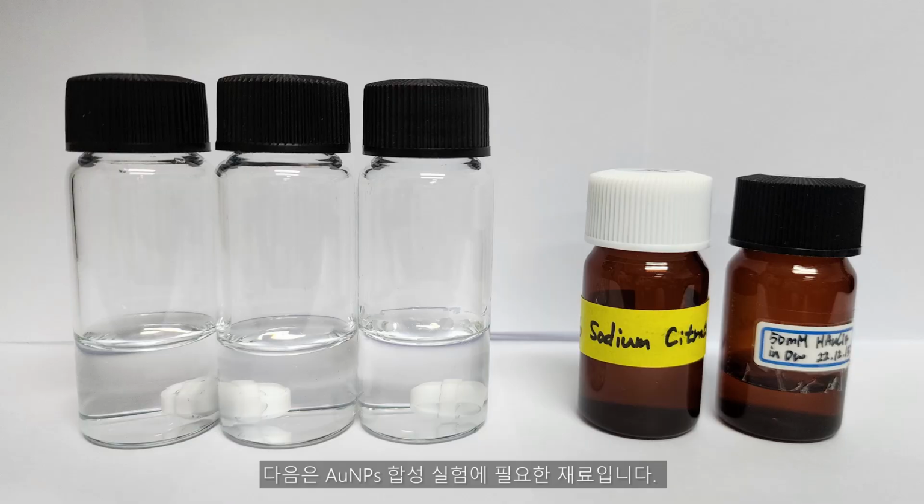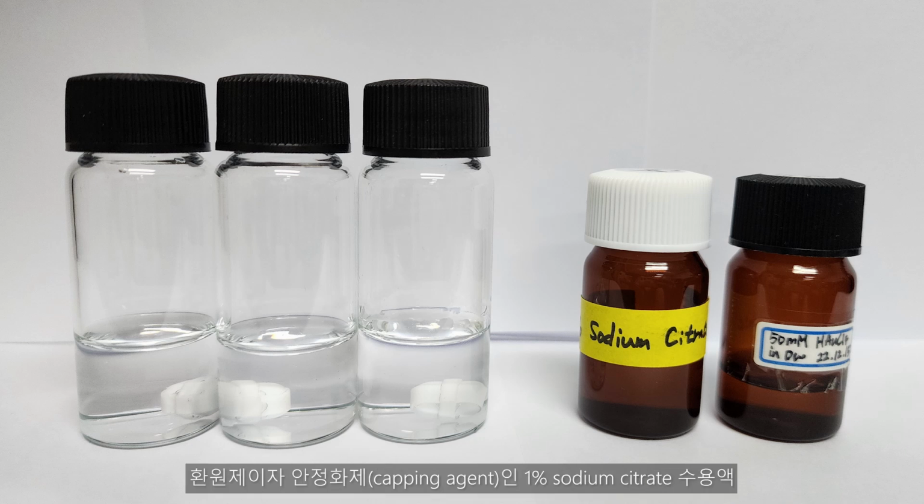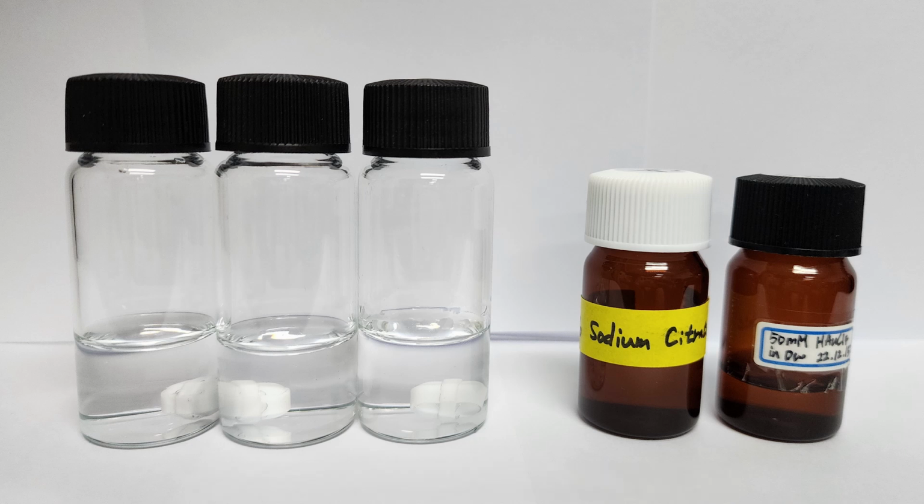The following are the materials needed for the gold nanoparticle synthesis: 3 vials containing 10 milliliters of distilled water and a stirring bar, an aqueous solution of 50 millimolar chloroauric acid to provide gold ions, and an aqueous solution of 1% sodium citrate as a reducing and capping agent.